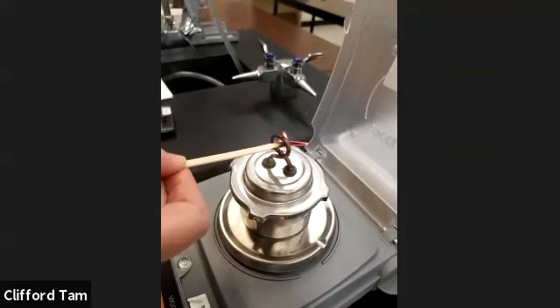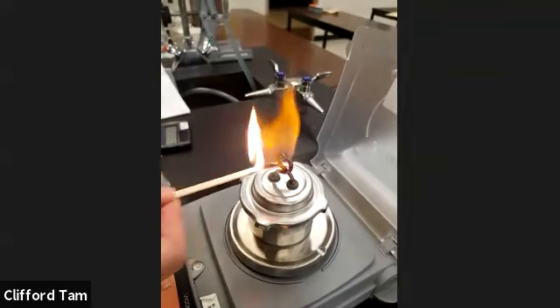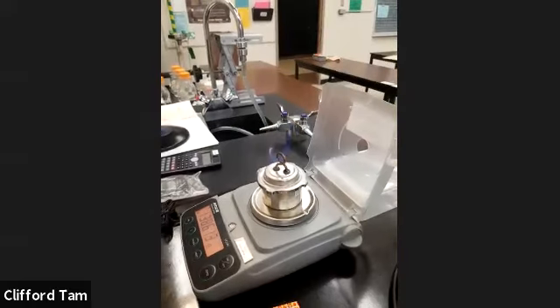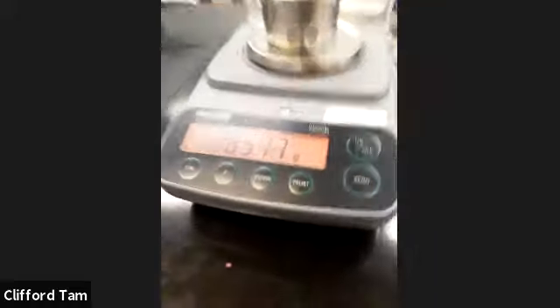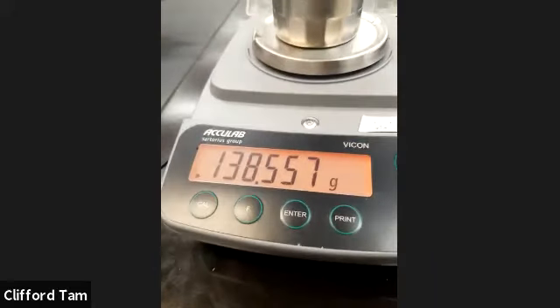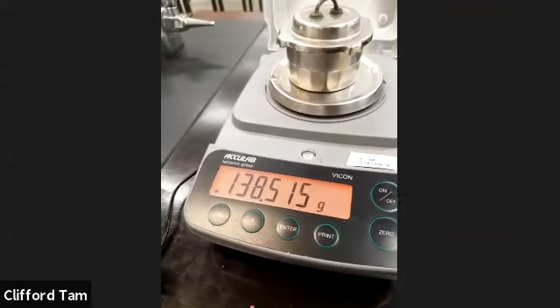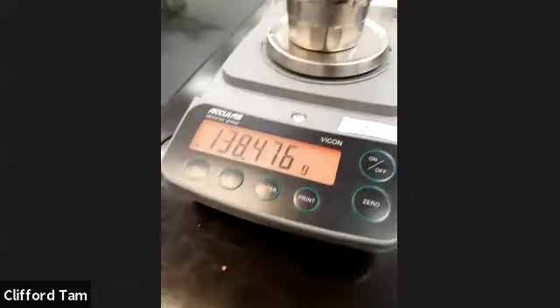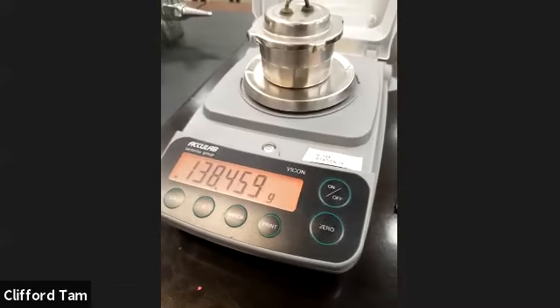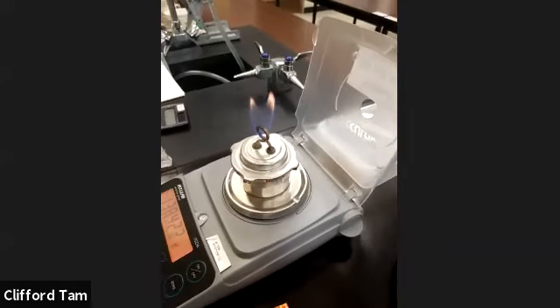Ooh, tough to light, but holy cow. Okay, excuse me. Now you can see it's going down much faster. Now look at that, guys. Remember, every second before, we had basically a thousandth of a gram dropping, right? Now it's dropping probably by a hundredth every single second. So it's just about 10 times faster in comparison to the paraffin.